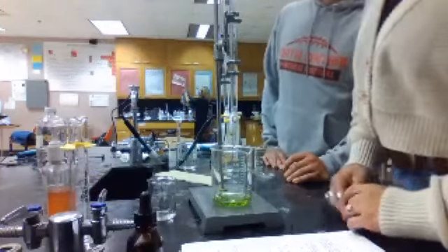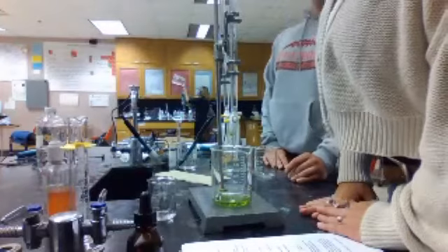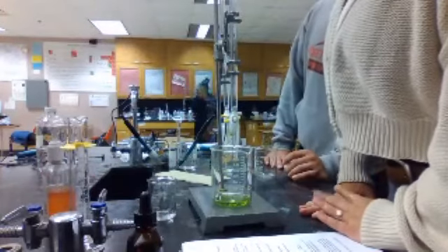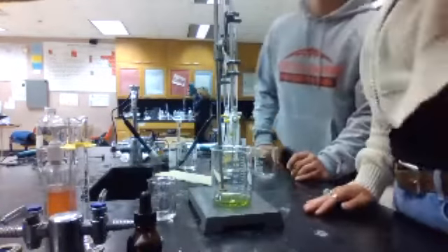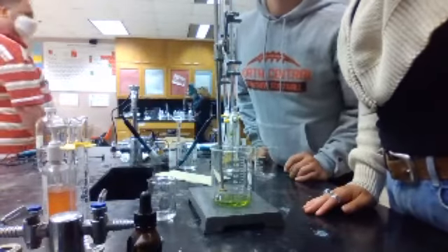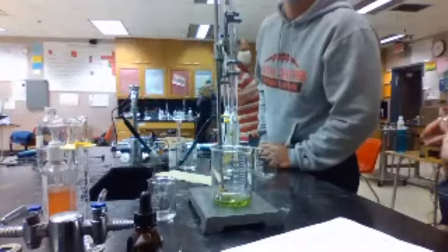And it's at 9.79. Are you guys measuring from the bottom of it? Yeah, I'm so confused. It looks like 9.9 something to me. Yeah, it's really close to the 10. It looks like 9.99. There we go. Okay, we just have to make sure we do the same measurement each time.